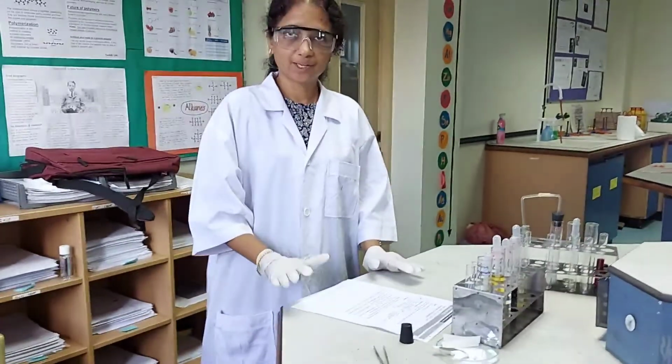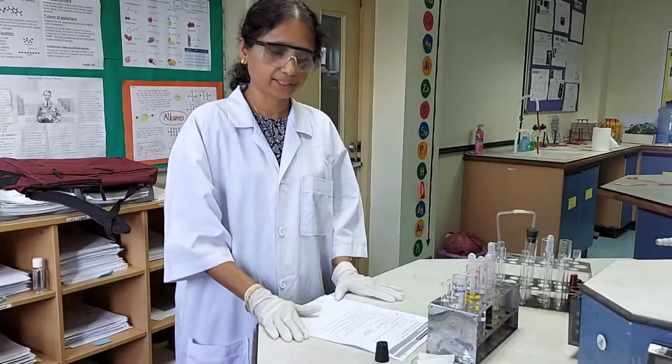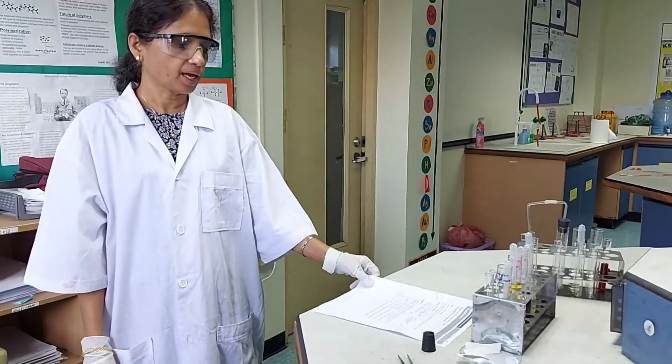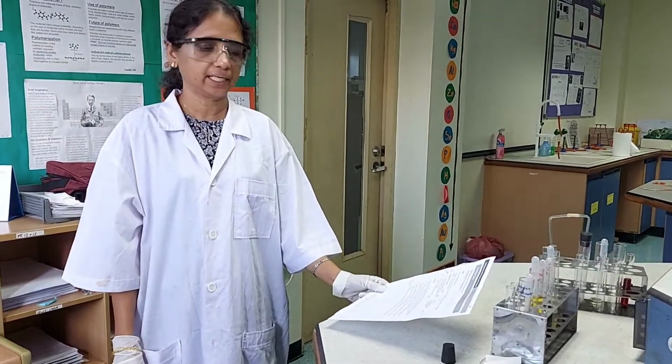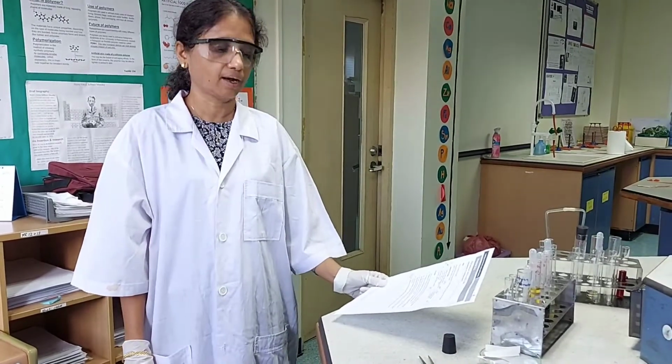So your task now is to make a note of the observations and write up the practical. Include balanced equations and ionic equations for the practical that you write up. And then you got to research the relevant standard electrode potentials and explain why the reactions are taking place.